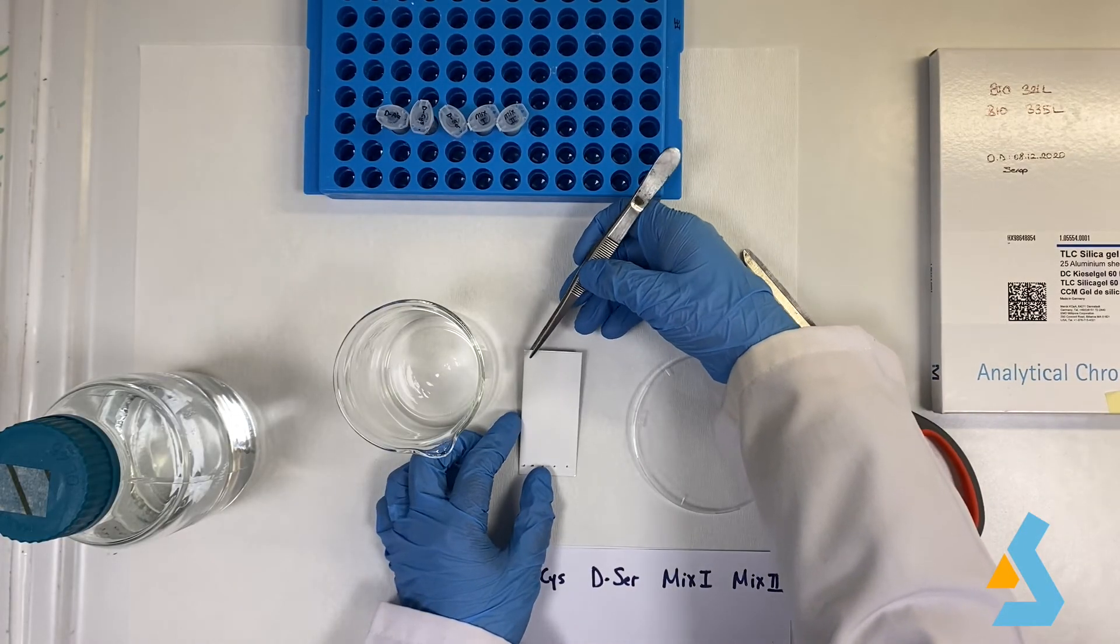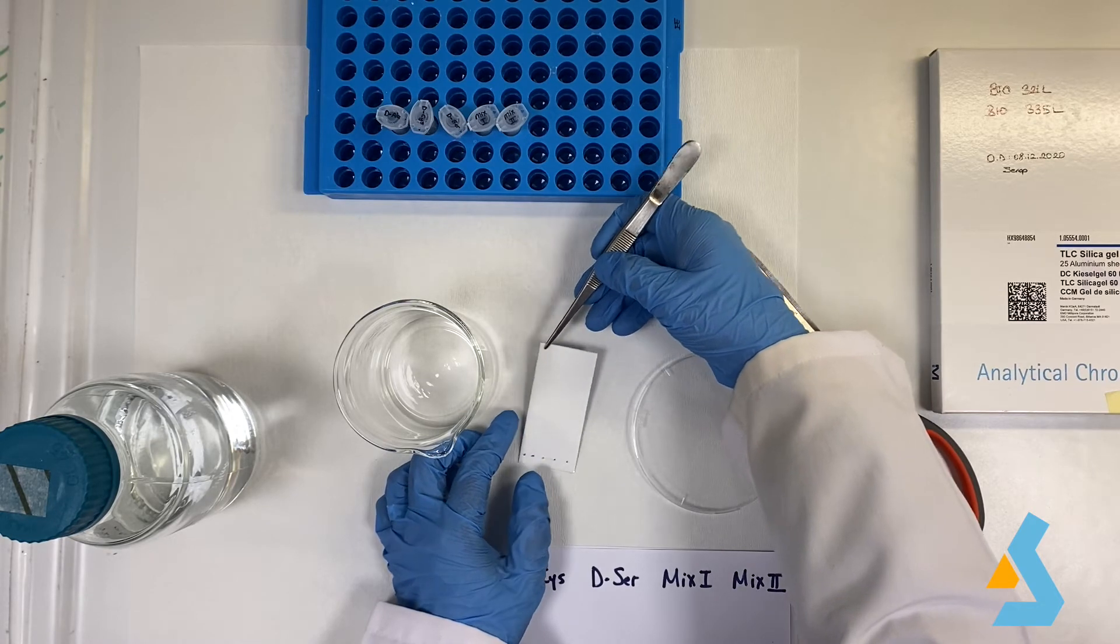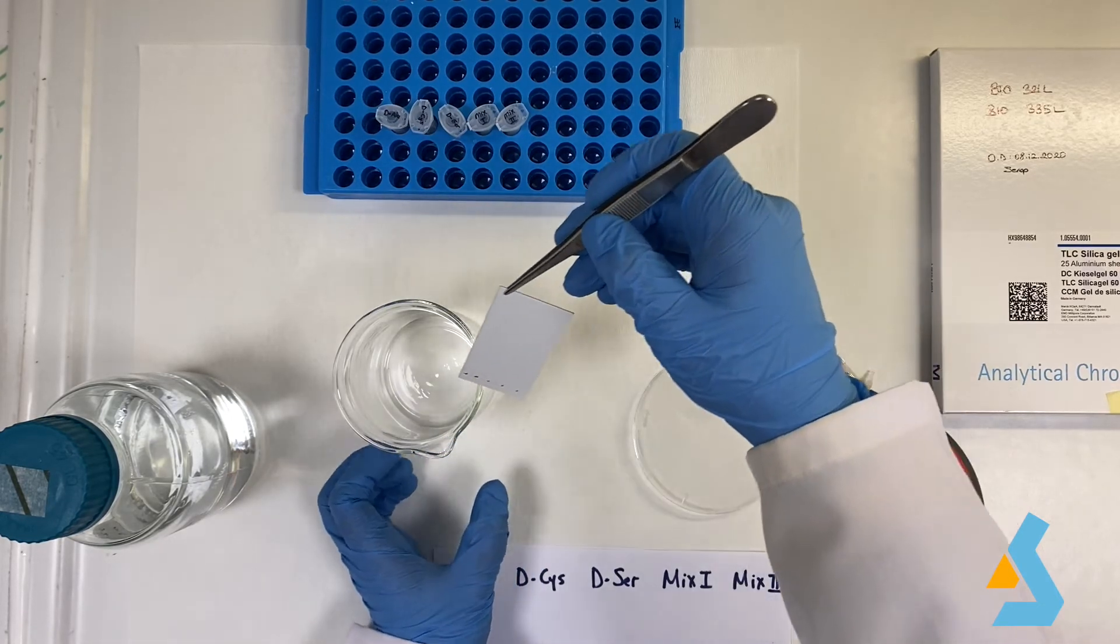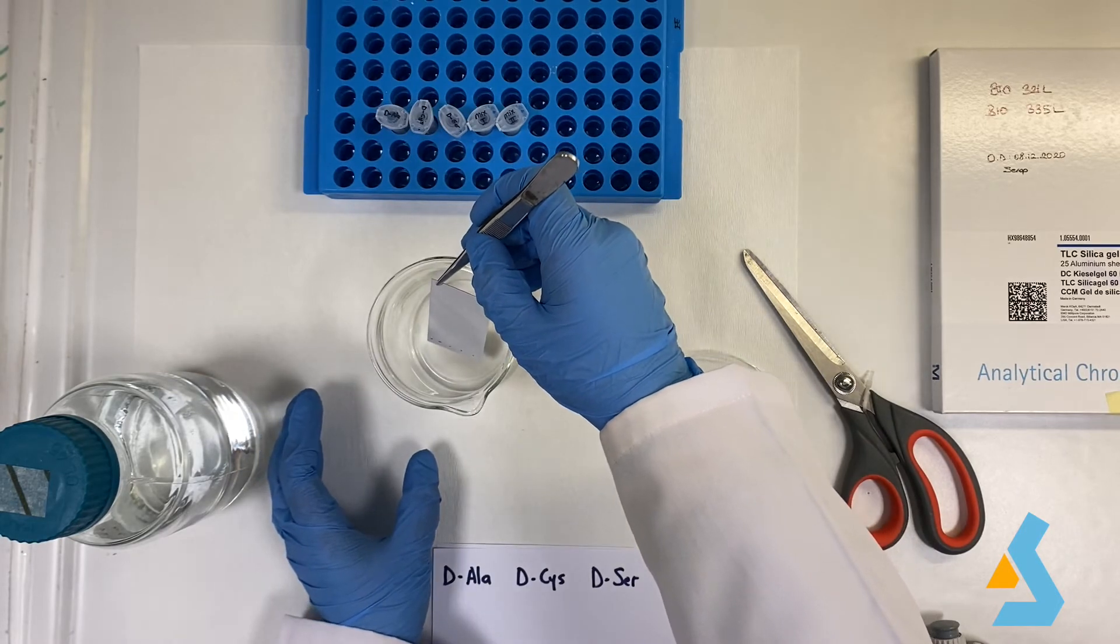We then place the plate into the beaker carefully with the help of a tweezer. Then, we close the beaker with a lid to avoid evaporation.